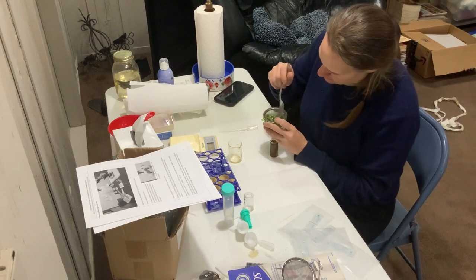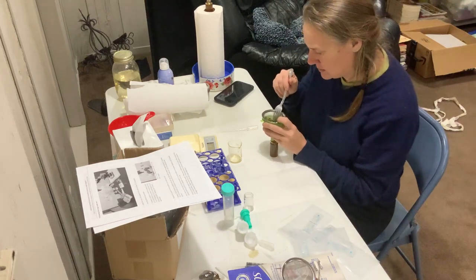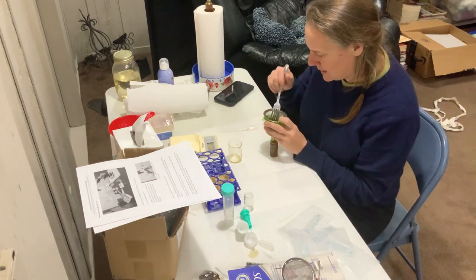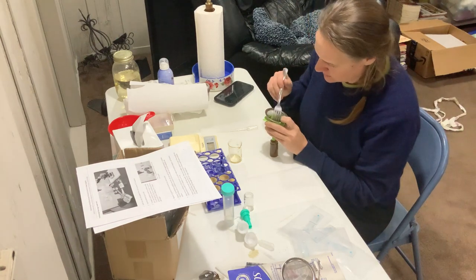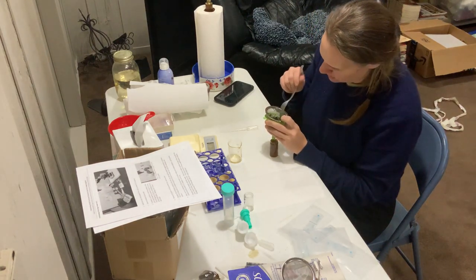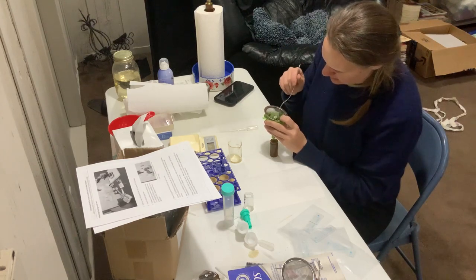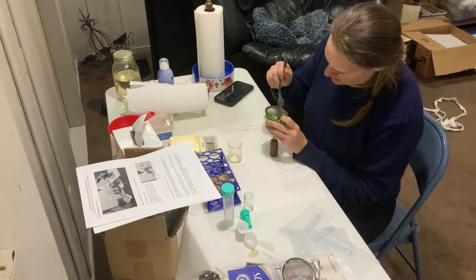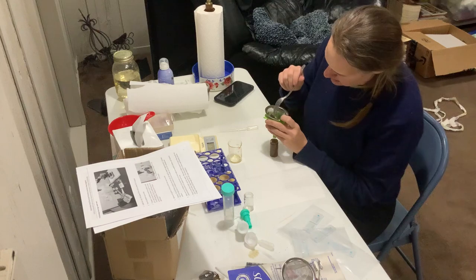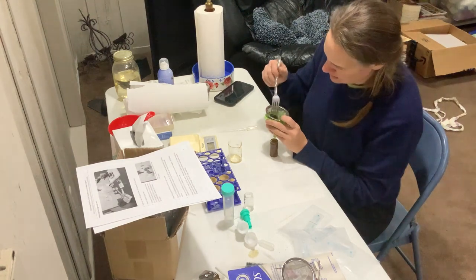I'm not an expert at this — it's just a couple of times I've been doing it. When I've talked with my vet, he's basically like, this is pointless. Yeah, we know they've got eggs, we know they've got worms. The reason we're doing this though is because we don't need to know exactly how many worms she has. He's saying even if there's a million in there, don't be quick to worm, because if it's not affecting her, don't worm her. I am going to see what kind of worms are there so that if I do worm her, I'll know which wormer to give.